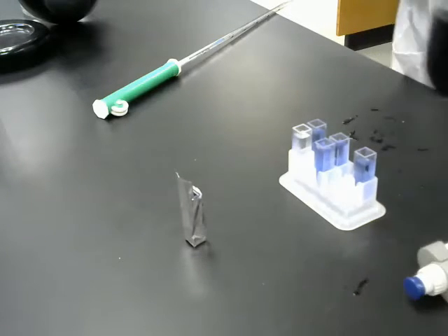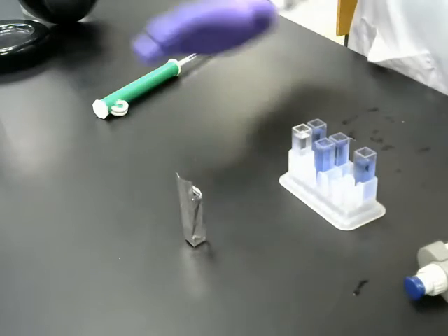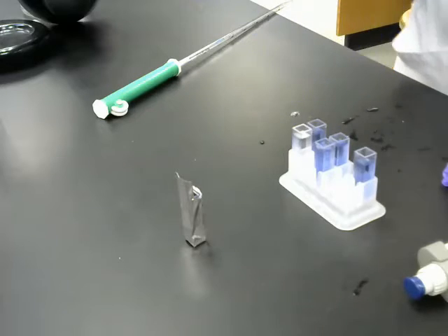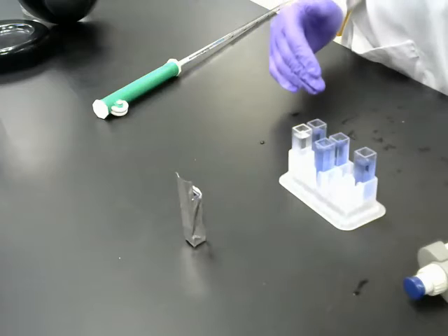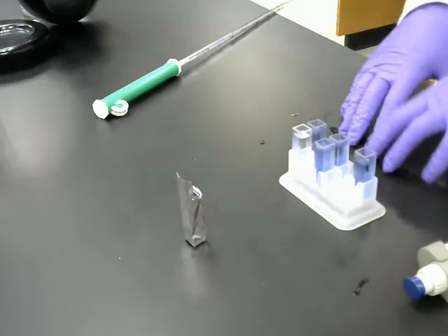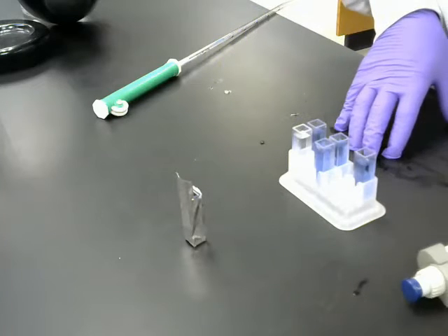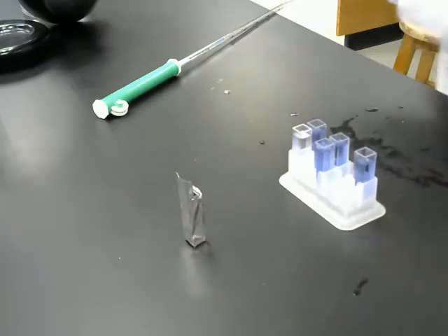So now everything has been added that we need except for the chloroplast. So other than that, everything is set to go. So I'm going to get the rest of the experiment set up, and then I'll show you the setup. Once the experiment's underway, it's going to be very dark, and I'm not sure how much you're actually going to be able to see besides me actually using the spectrophotometer. But we'll cross that bridge when we get to it. So give me a minute to get everything else set up, and I'll be back.